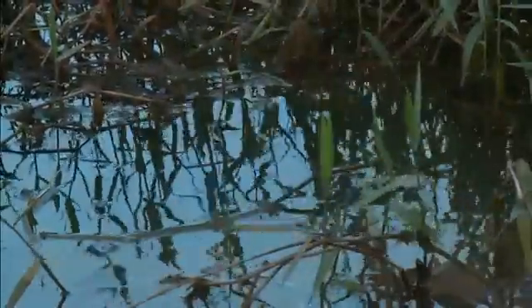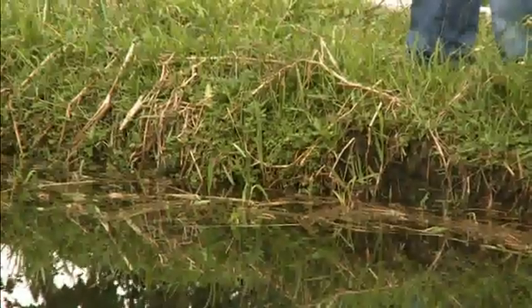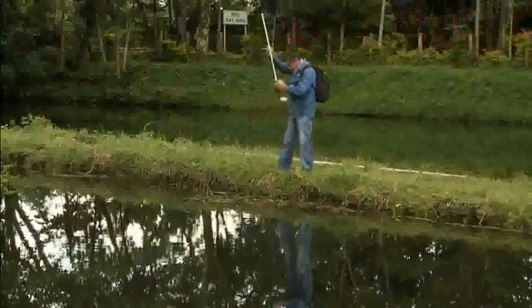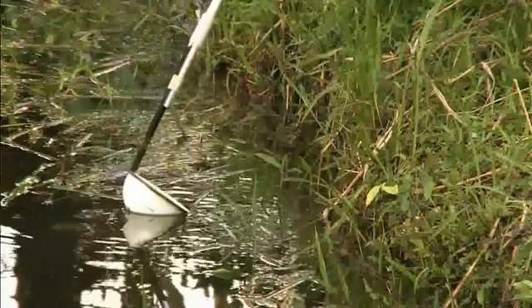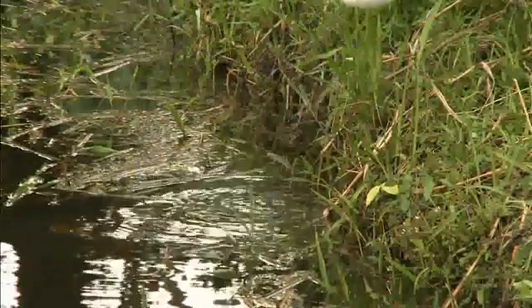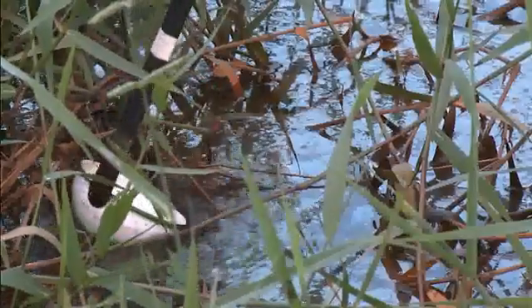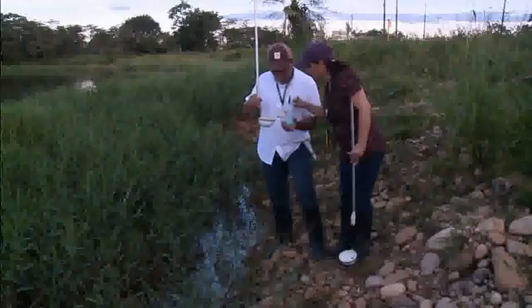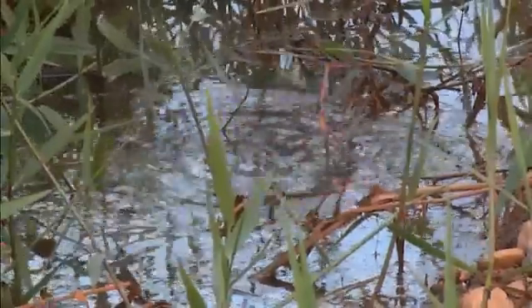Larvae and pupae may be found at the surface of the water among aquatic vegetation or floating debris. Therefore, larvae and pupae can be collected with a shallow skimming stroke just below the surface. Surface water will flow into the cavity, but care should be taken not to fill this completely, as some larvae will be washed out. If the larvae are disturbed, wait a minute or two for them to resurface.